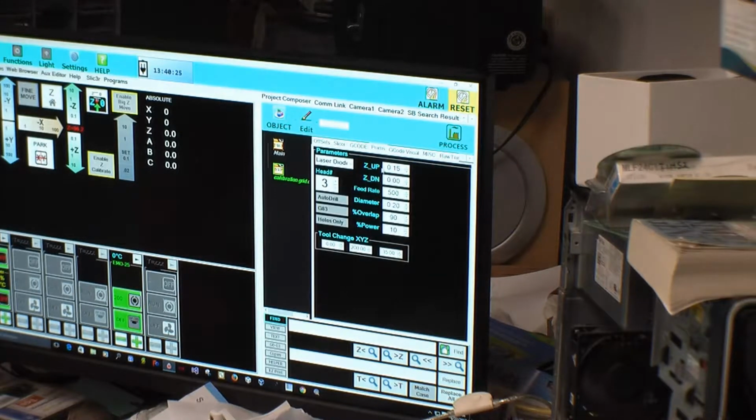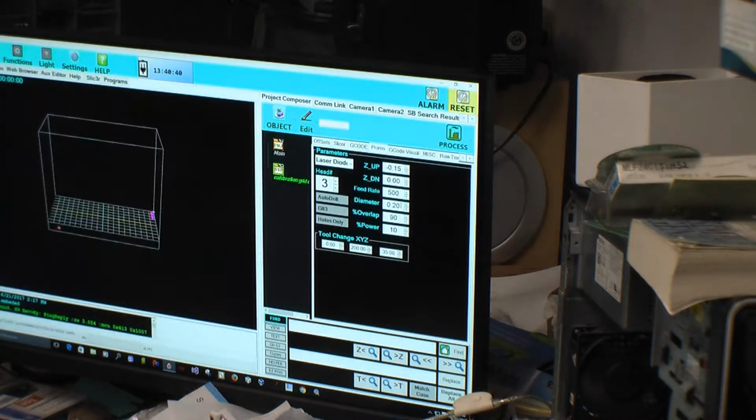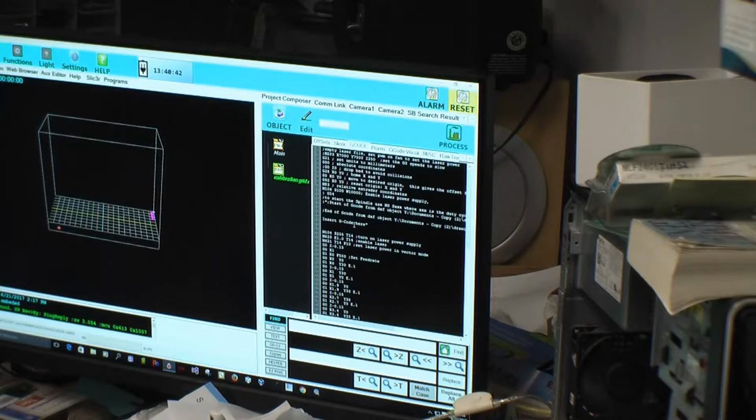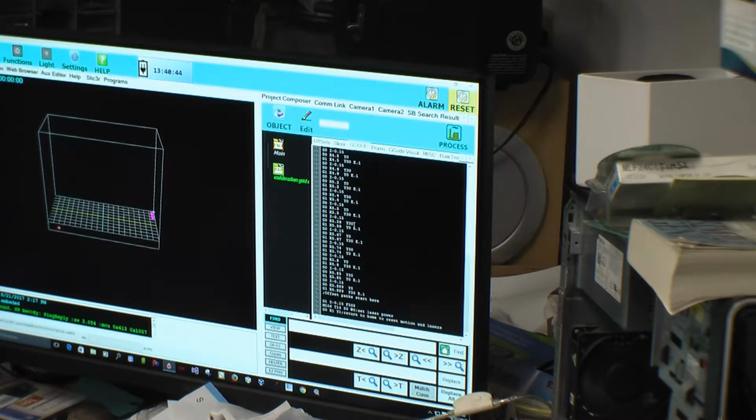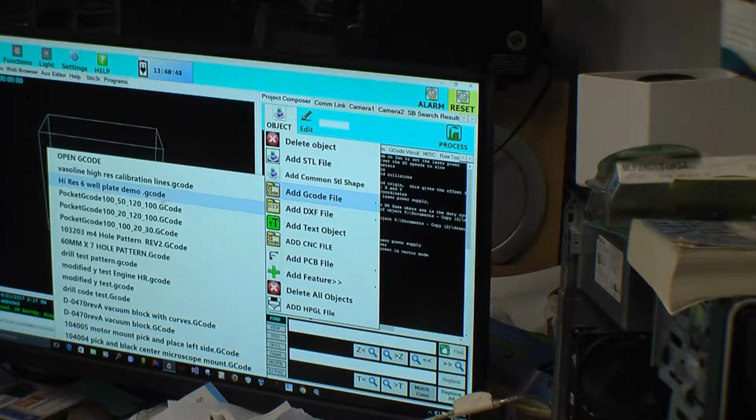Let's look at our parameters. Let's go in minus. Minus 0.15. No, that's positive going down. Yep. Well, let's find out what happens. If you do what I think it did, it overwrote it. Alright, it did. So now I gotta open up this other one.